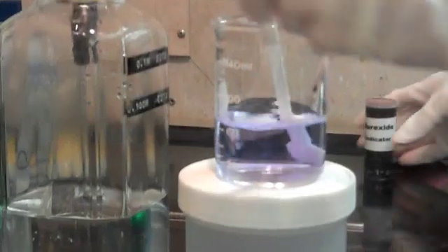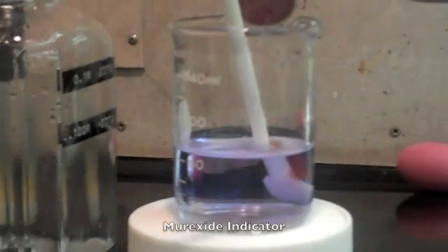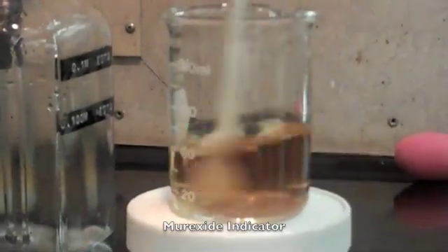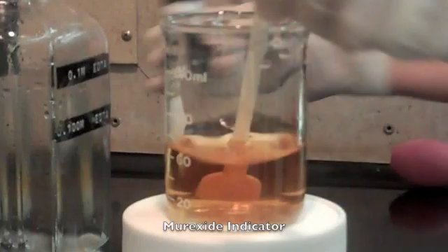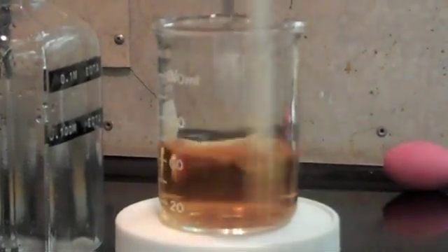For our indicator we're using murexide and this is a powdered indicator. We need about a half a gram, very small amount which is pretty much just a shake. Now we have an orange color as the nickel is forming a complex with the murexide.